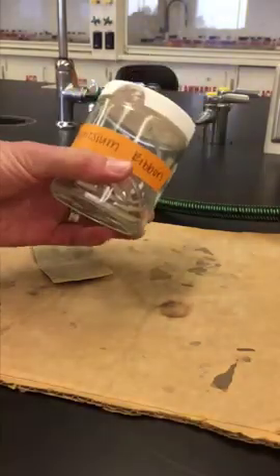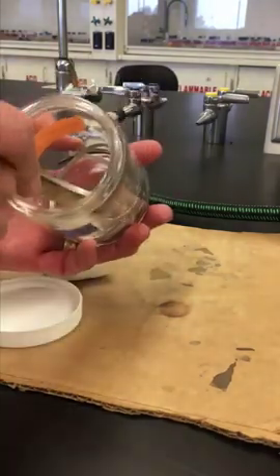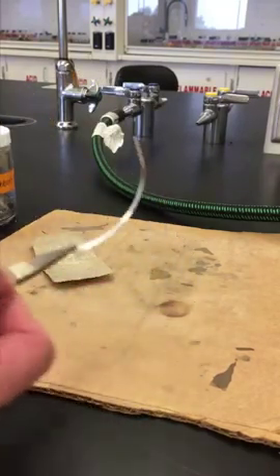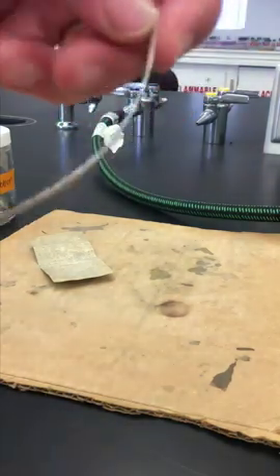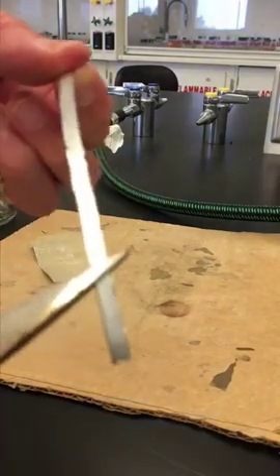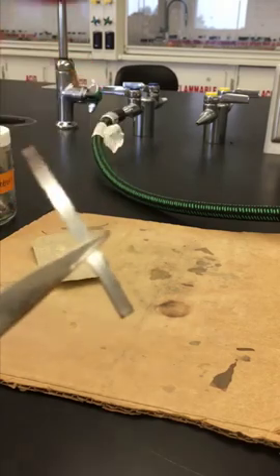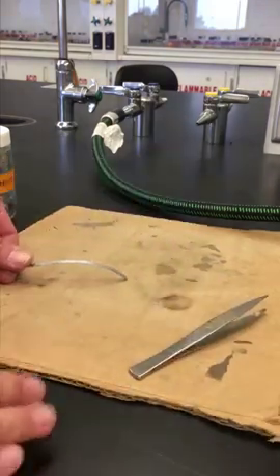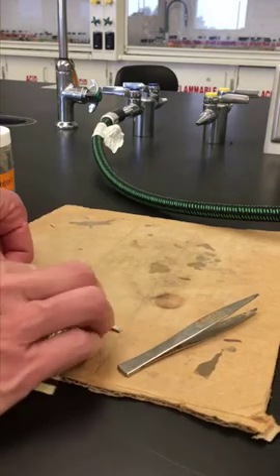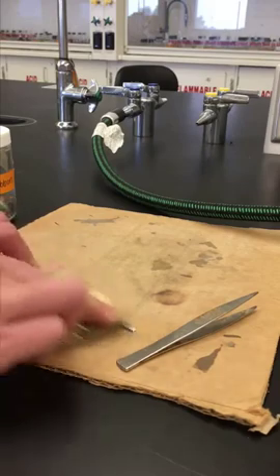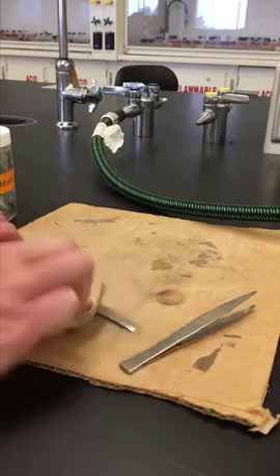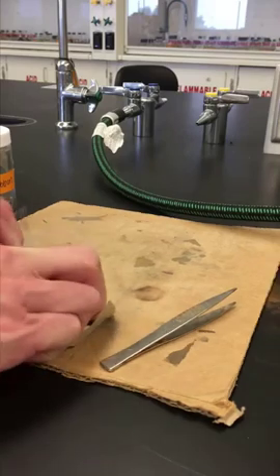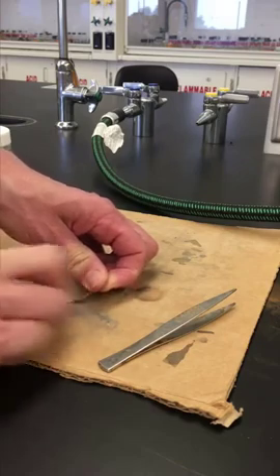To prepare the magnesium sample, we want some magnesium ribbon. We're going to pull a sample of magnesium ribbon out from our jar. And the magnesium ribbon that you see here, it has some, it could have some dark lines on it. And that's because magnesium does react with oxygen in the air at room temperature, but it's very slow. So we want to take all this oxide layer off, this black layer off. So in order to do that, you take some sandpaper. Do not sand right on the bench, because that will scratch up the bench. Make sure you use a piece of cardboard. And then just sand your sample so it is nice and shiny. Trying to get as much of the black oxide off as you can.